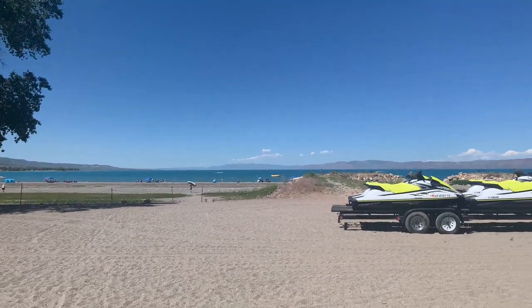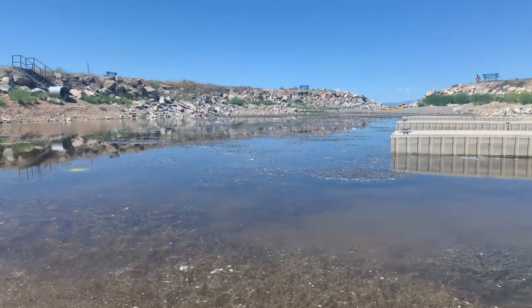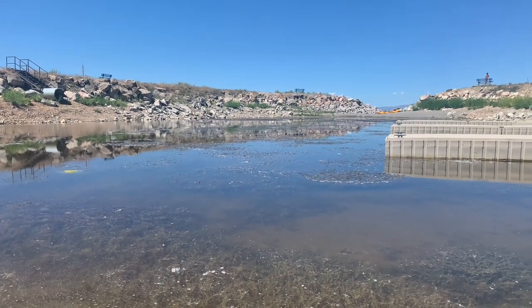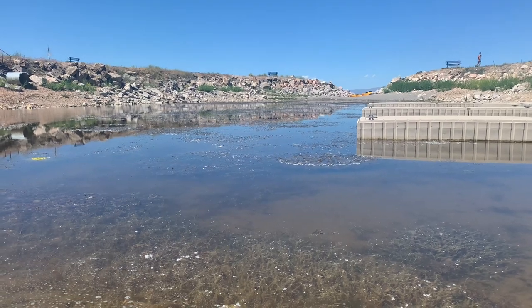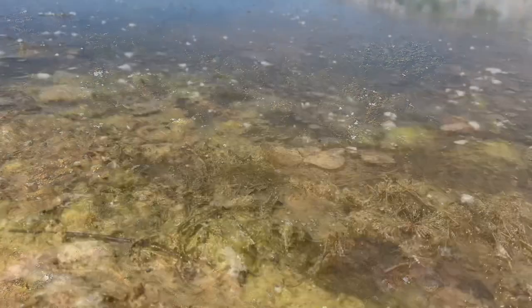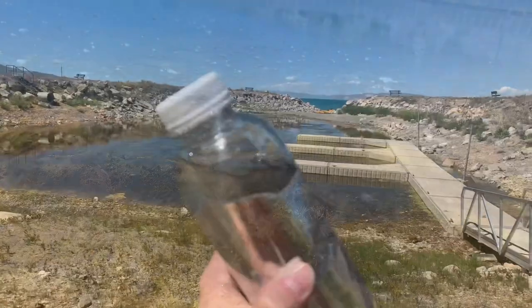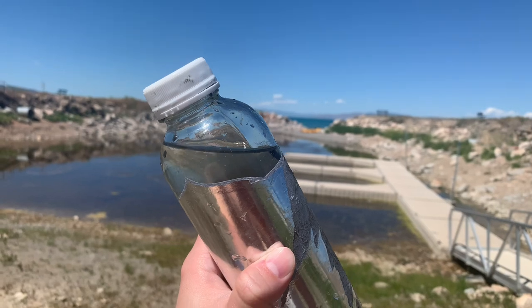So we're at Bear Lake, Utah here, and there's a little marina that doesn't really connect to the lake, so it is kind of stagnant and it allows for a lot of microbial diversity. I collected some of this algae here and put it in a water bottle, and let's go ahead and take a look at it.